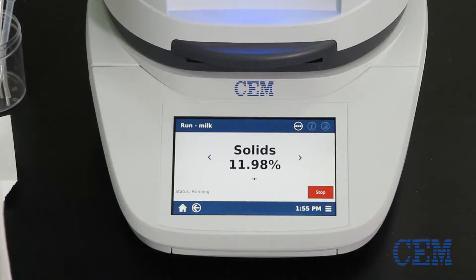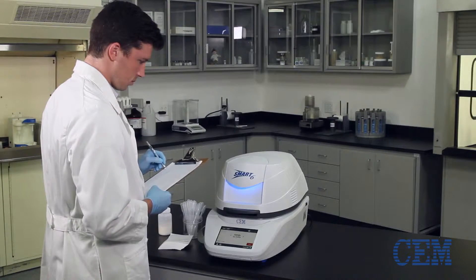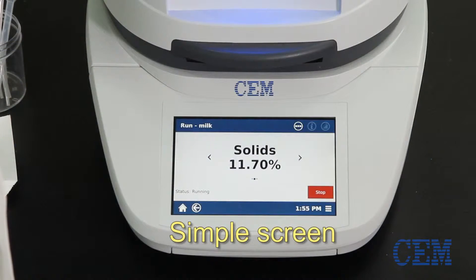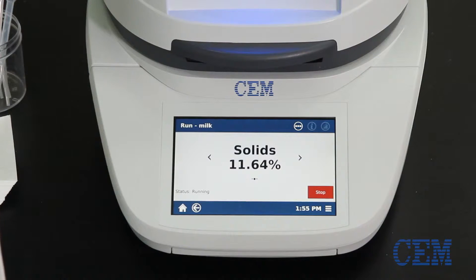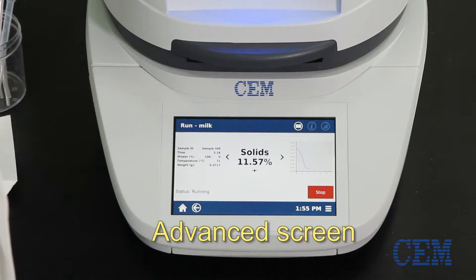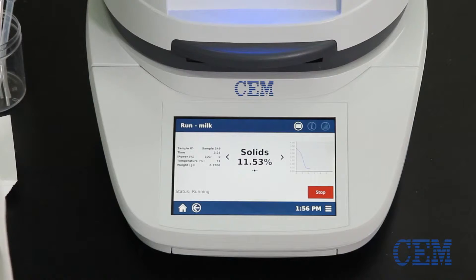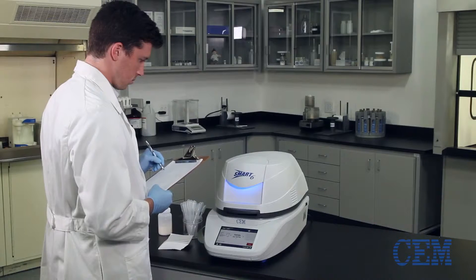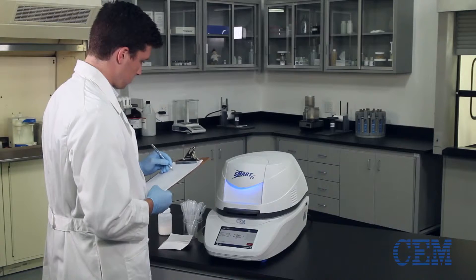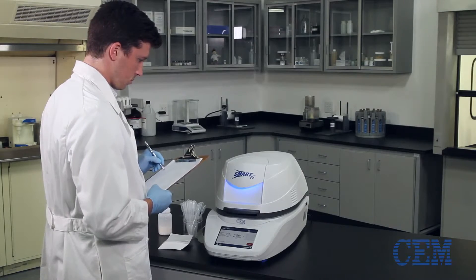During analysis, you can choose between two different unique screens for viewing test results. If you're using the Smart 6 for process control analysis, the Simple screen provides a clean view of the current moisture or solid status during the drying process. Use the Advanced screen if you're analyzing samples for research and developmental purposes and are interested in temperature and power parameters. Using this screen, you can also view a graph of real-time weight loss and temperature. Both screens display the same results, but give you the option of viewing the information in a way that's most convenient for you.